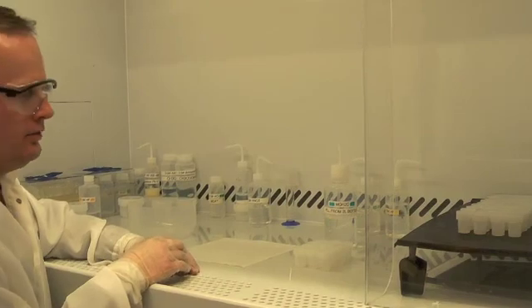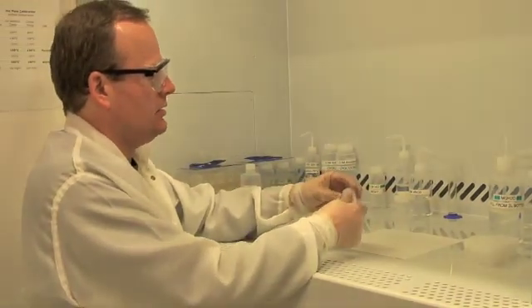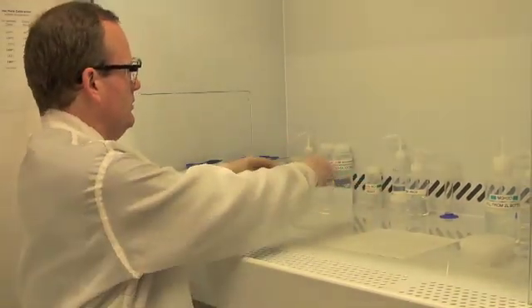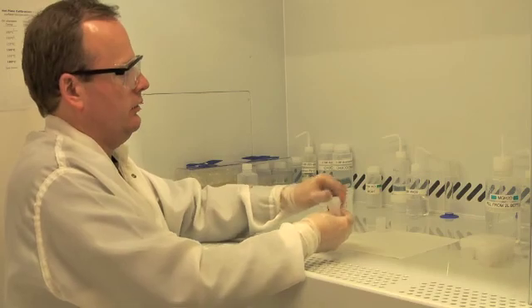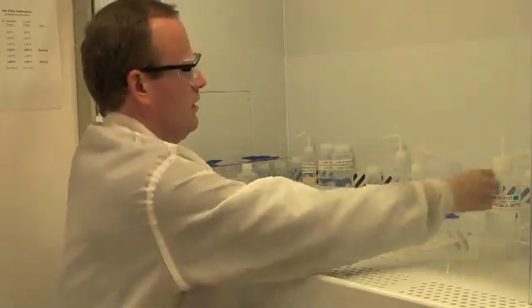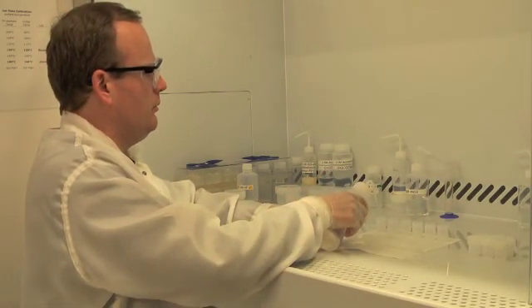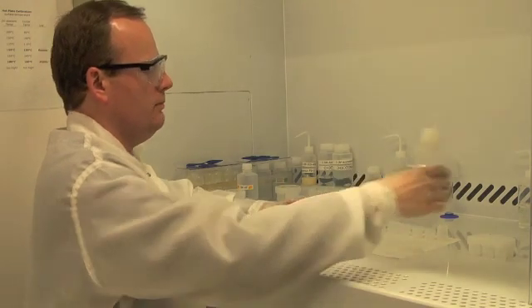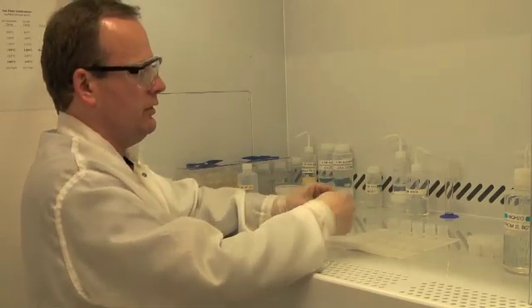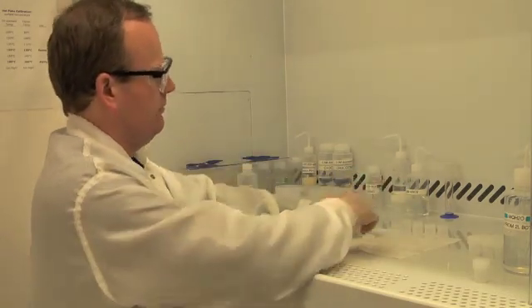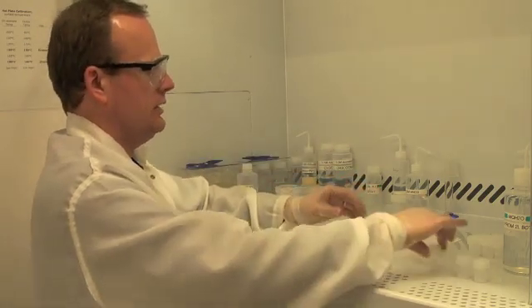I've been cleaning beakers on the hot plate overnight in both hydrofluoric and then in hydrochloric acid. I'm now ready to empty those beakers of their acid and give them a final rinse with clean water. I'm going to use my squeeze bottle of clean water, fill up one of those beakers to the brim and then I will rinse that out, cap it for use, and continue down the line.